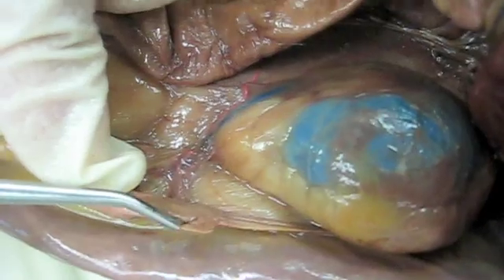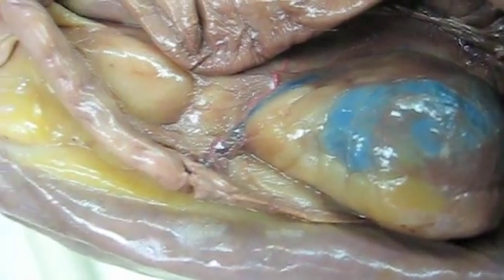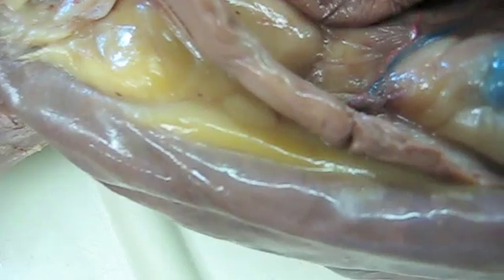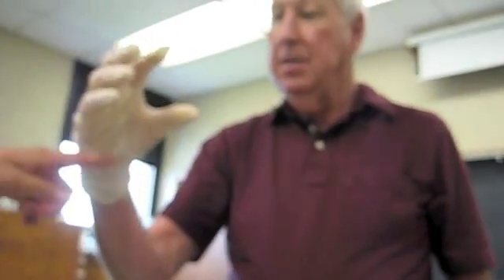Student: Is the infundibulum sort of like a pouch? Instructor: No, it's just the expanded end of the oviduct. So, if my arm were the oviduct, we've got this expanded end, which would be the infundibulum, and the ostium would be where the egg comes out of the ovary and then goes through the infundibulum and on down the oviduct. Student: So the ostium would be like this part?